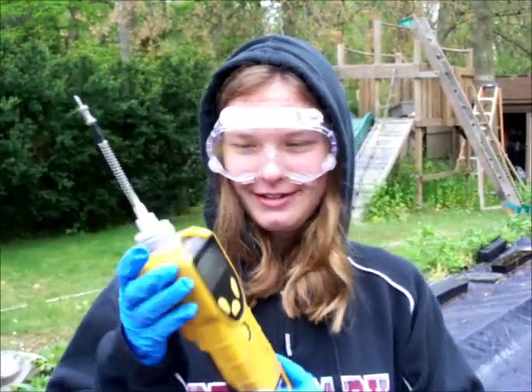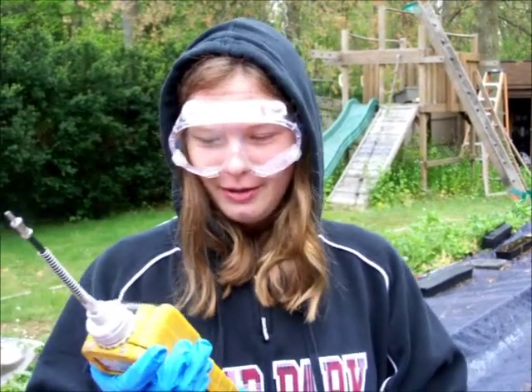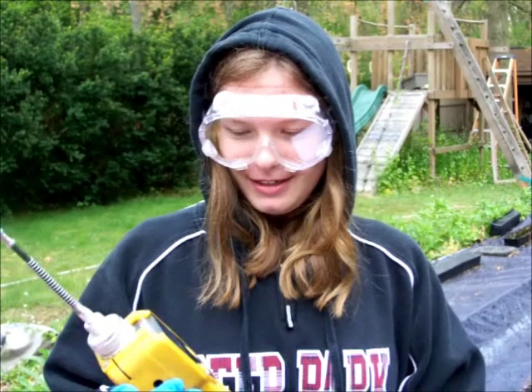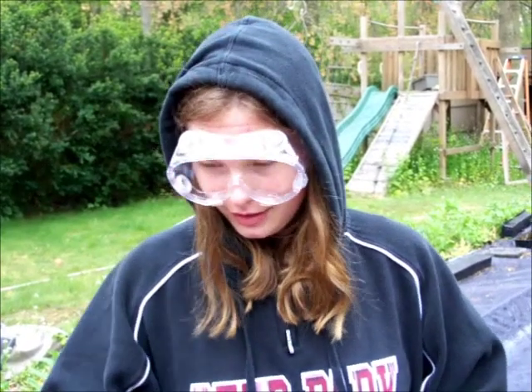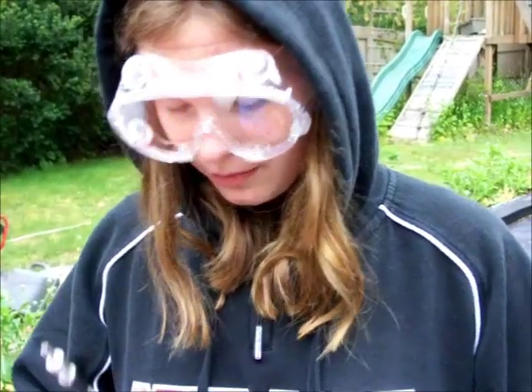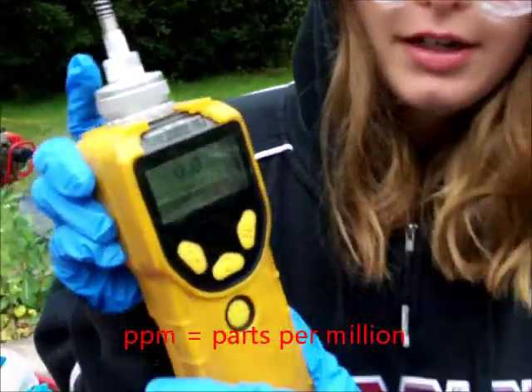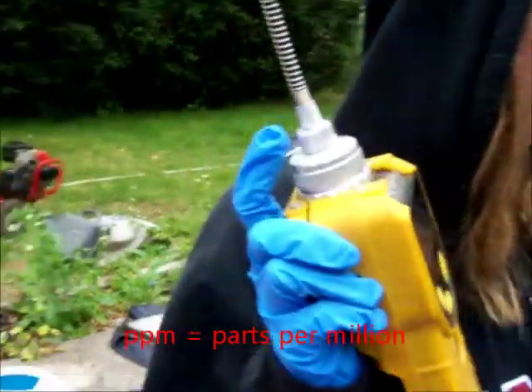What I have right here is this nifty little device called a PID, or photoionization detector. What it does is it measures volatile organics, and we will be using this to prove that this is actually reacting. If this is truly reacting, as it should, it will be giving off volatile organics, measured here in PPM. It says 0.0 right now, meaning there are no volatile organics.